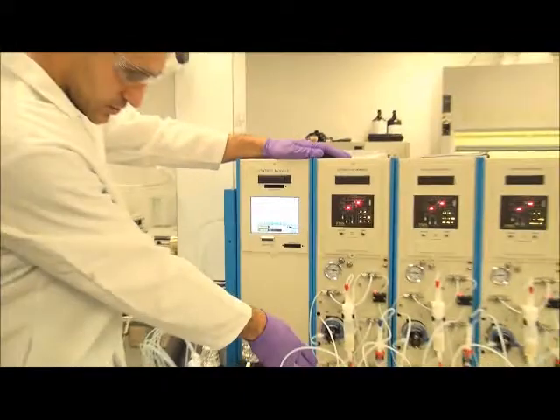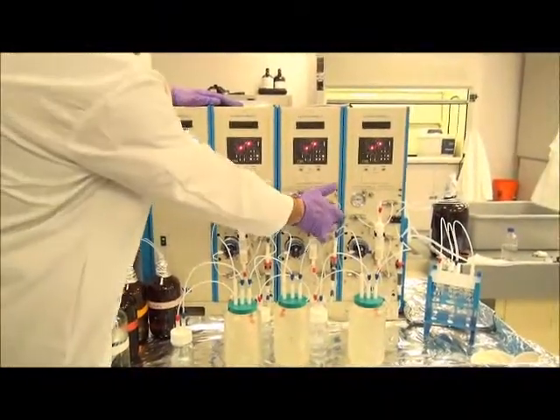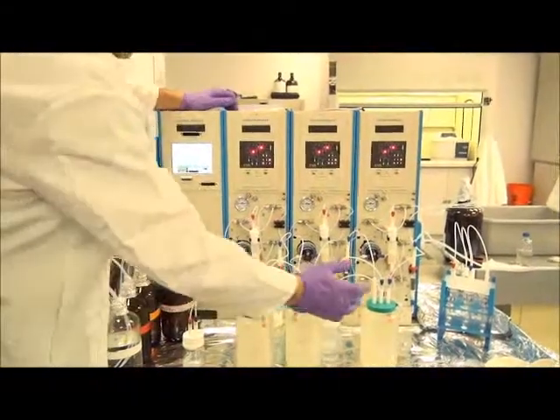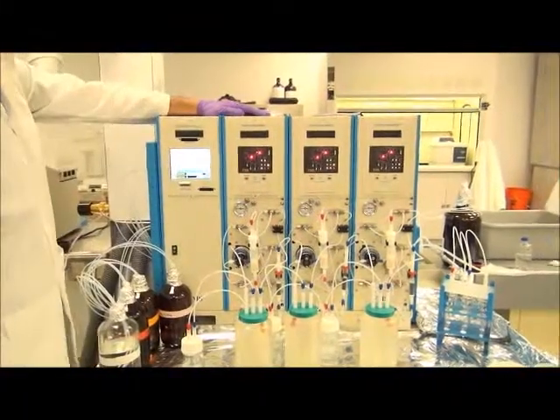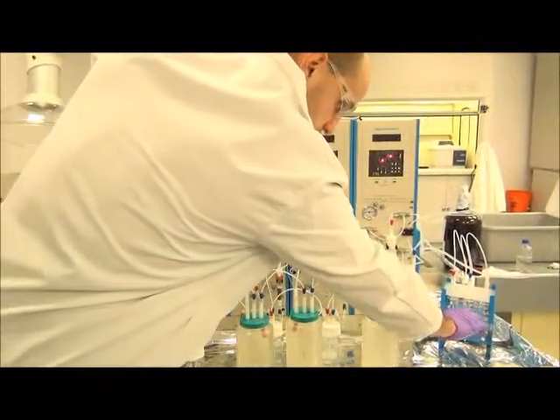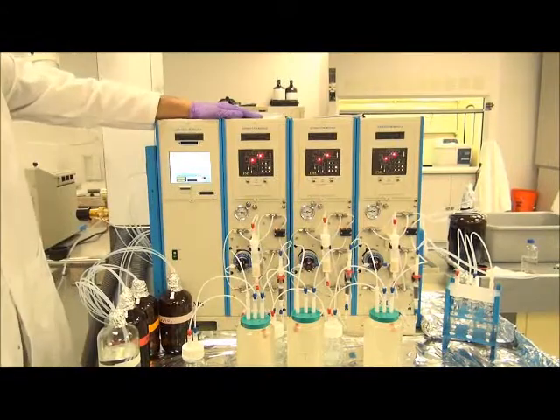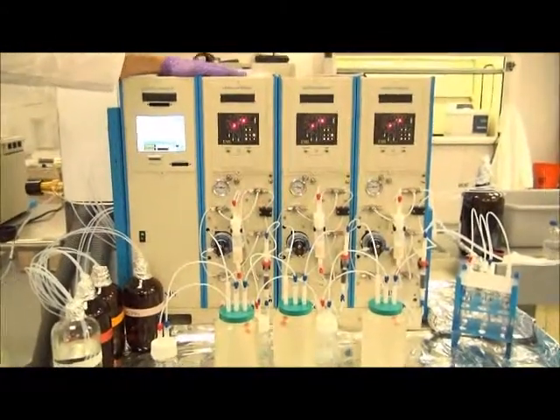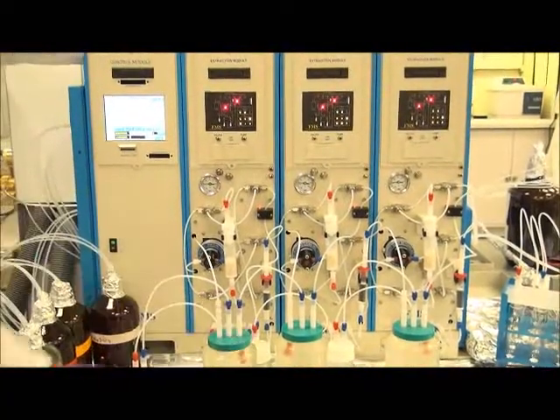As a quick overview of the system, as we pointed out the cartridges before, we have the solvent delivery pump along with the multiple solvent lines. We have a bubble sensor on each unit which will detect when each sequential sample is finished and stop each position from exceeding excess vacuum while the other samples load. And we have our multi-fraction collection vials which will separate both the acid and basic fractions from each other. Down there along with the sample bottles, we have 2 lines coming out and 1 going in.